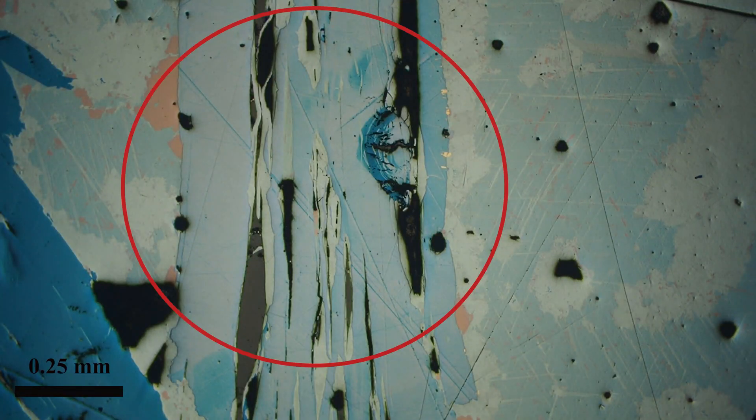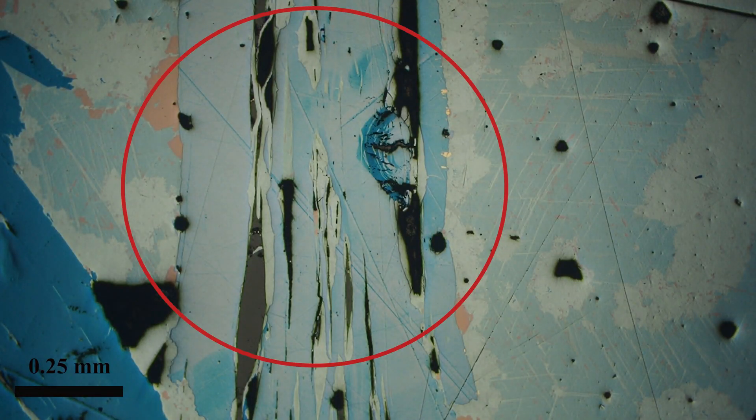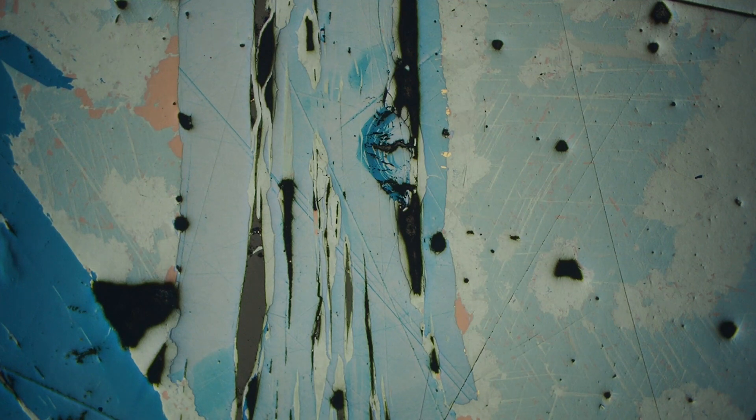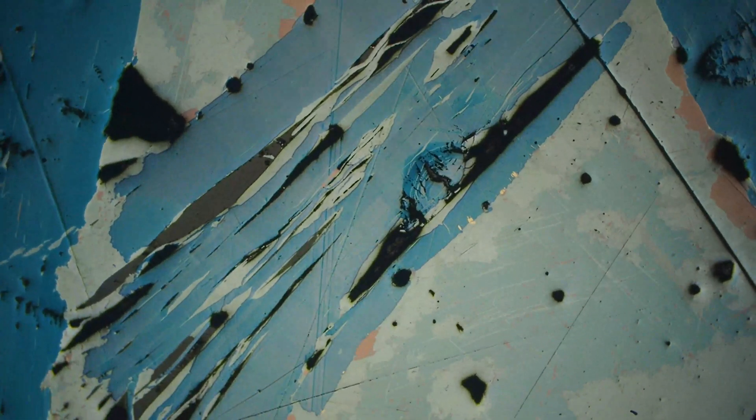We're going to go through one more example with a slightly different texture — still these radiating crystals. Here again is covellite, and you can see as we rotate the stage it's going from really dark blue through to white.